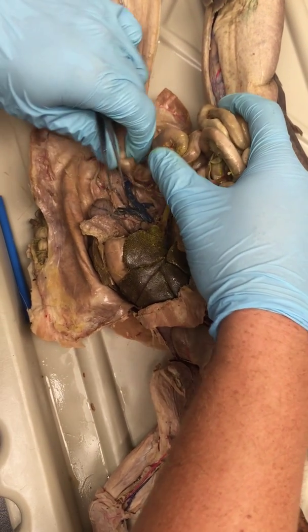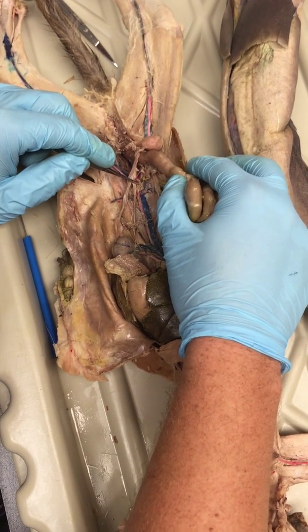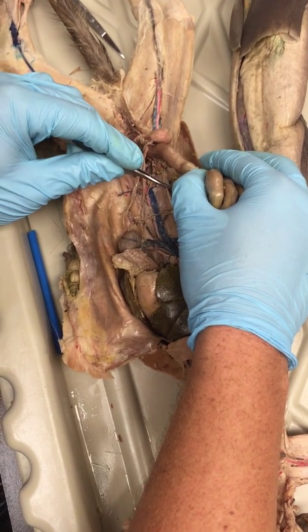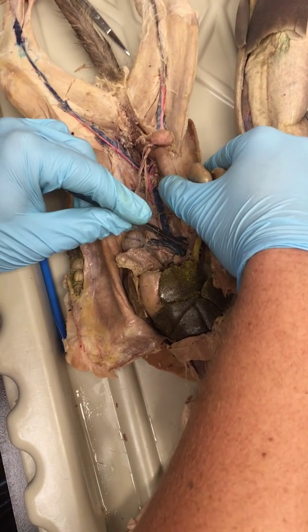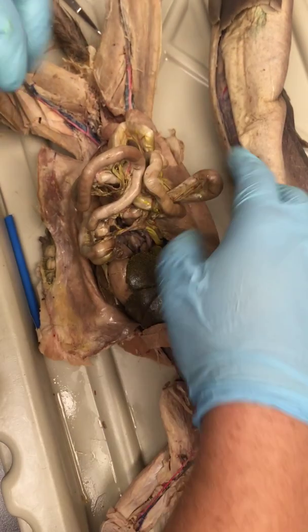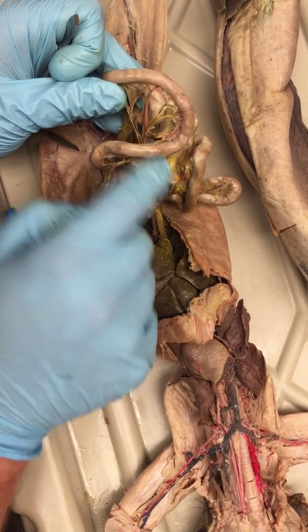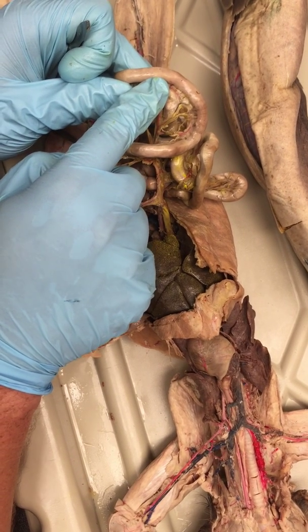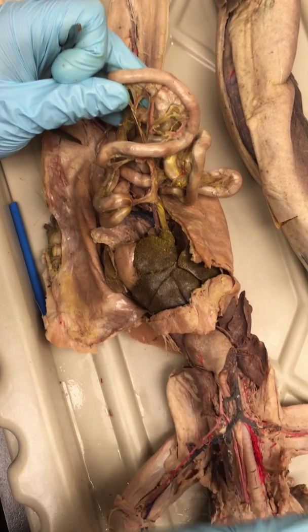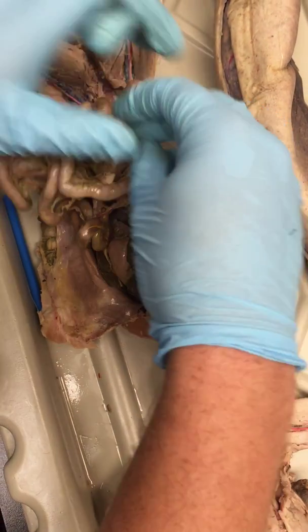On the bottom, you will often find the inferior mesenteric, which is down here. Now, the inferior mesenteric comes up here into the large intestine, whereas the superior mesenteric services all of these intestines up here. And up here in this area, this is going to be mesenteric arteries, whereas on the intestines themselves, they're going to be intestinal arteries. It goes the same way for the veins, mesenteric veins and intestinal veins.